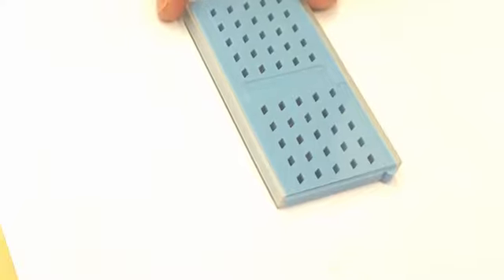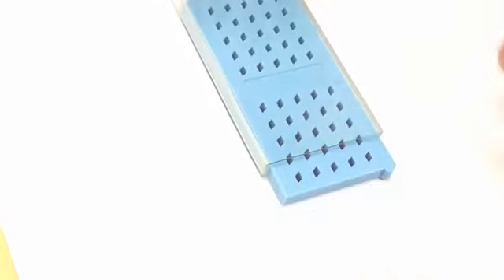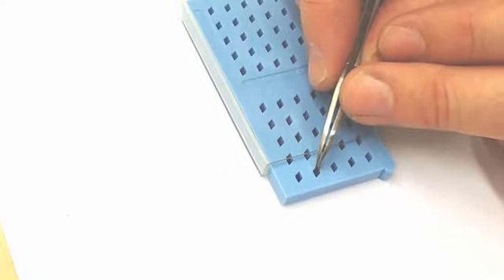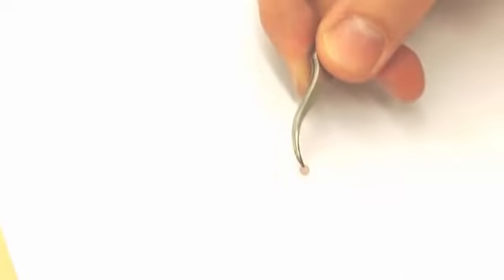When you do TEM analysis, you usually put your samples on small metallic grids. And these grids you buy, and they usually come in a box that looks like this. So here you have several small holes, and in each hole there is a small one of these metallic grids. If you open the box, then you can pick up one of these, and then you can see that it looks sort of like this. Very tiny little dish. This dish is sort of 3 mm across.